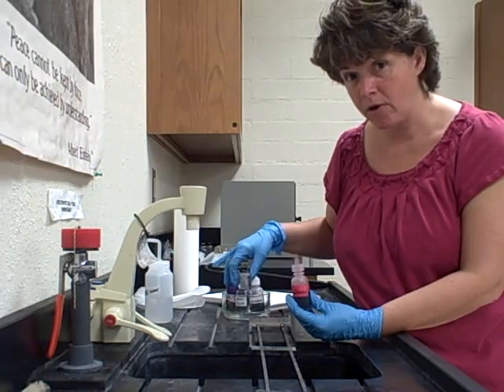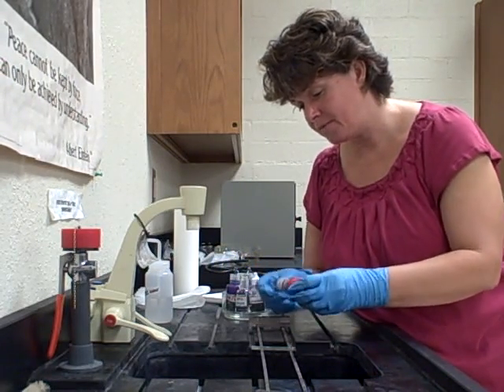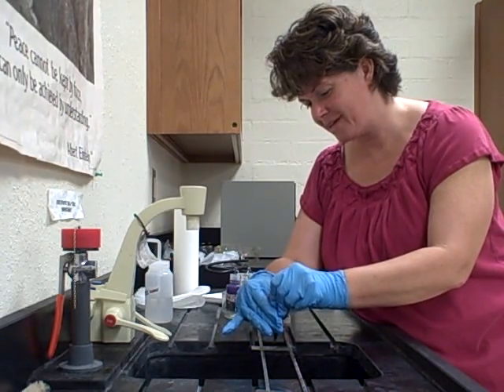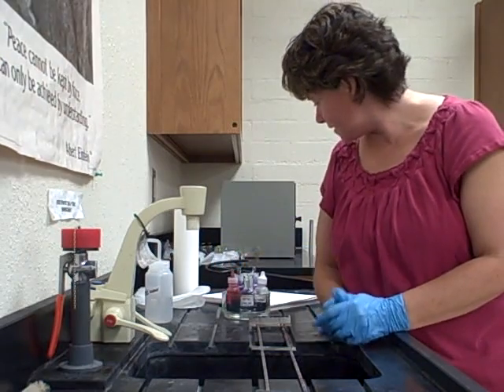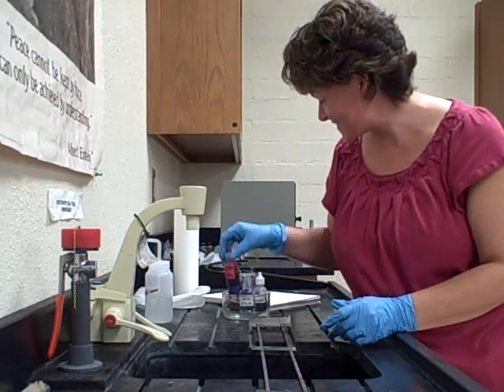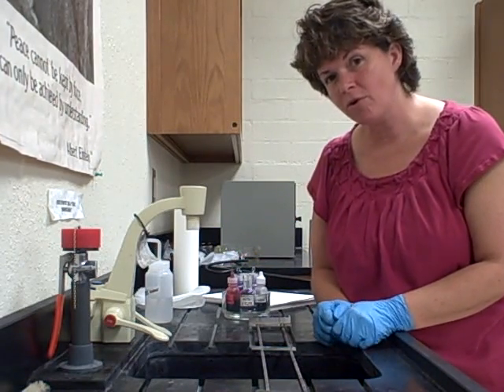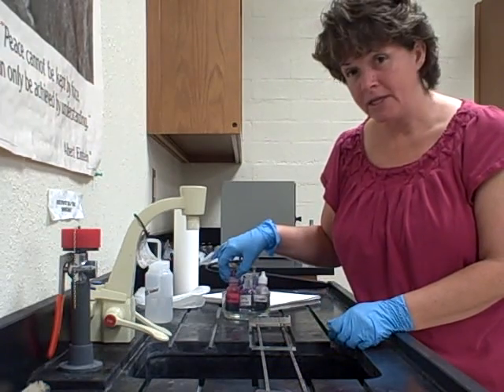If the bacteria are gram-negative and the crystal violet washed off with the alcohol, they're going to turn pink from the safranin. We're going to put the safranin on — that's the counter stain — and let it sit for about 30 seconds. If you go over a little bit, that's okay.